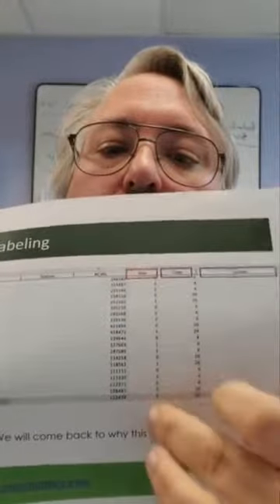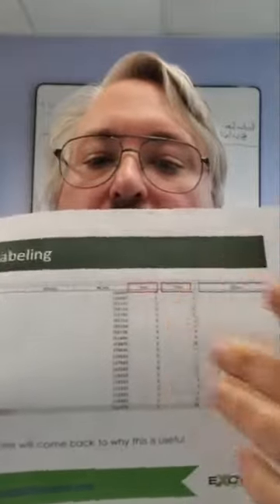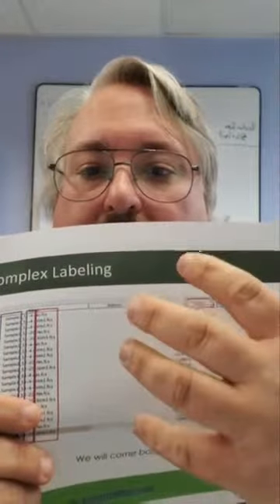And then over here on this side, we have the column for stimulation, which condition, the time of stimulation, and then the sample number. Now all this is embedded in my FlowJo file. It does not get embedded in the original data, but it is in my FlowJo file, so when these are pulled up, I will have those. And I can use those to sort my data in a wide variety of ways. If I wanted to look at just a certain stimulation condition, or a certain time point, that can be very, very useful.